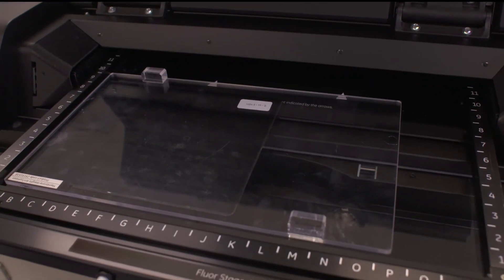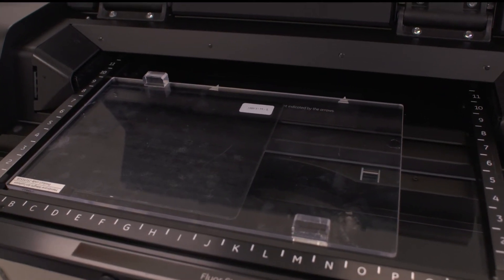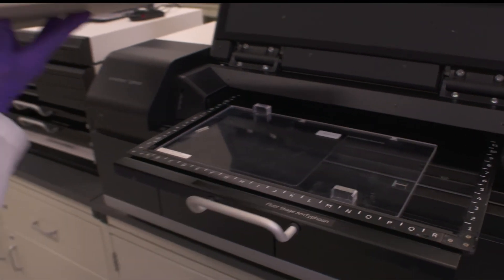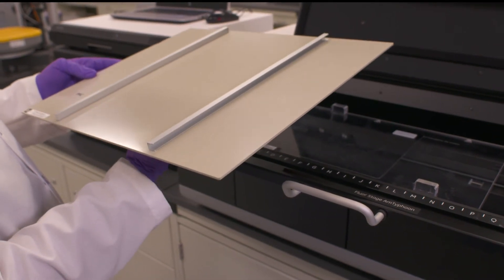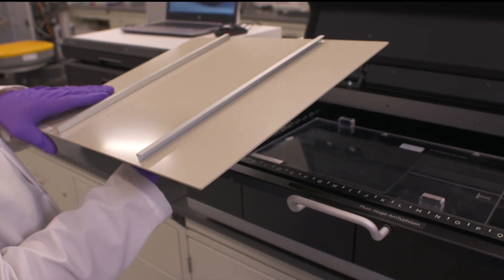If you have a really large storage phosphor screen, we also have this beige plate for doing the digitization, but we can use this to actually weigh down the large storage phosphor screens if you're using those with the instrument.